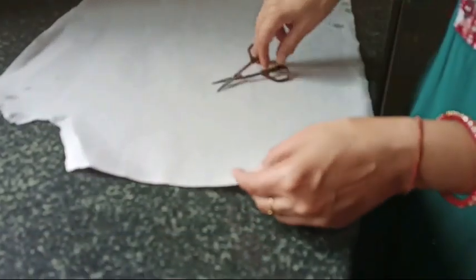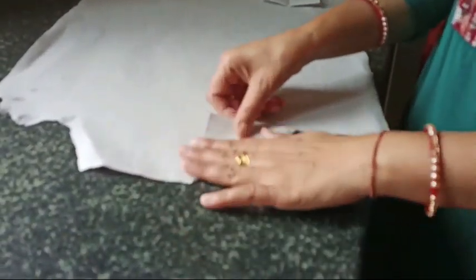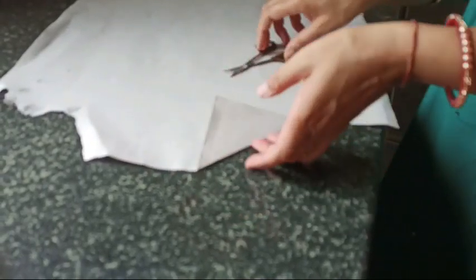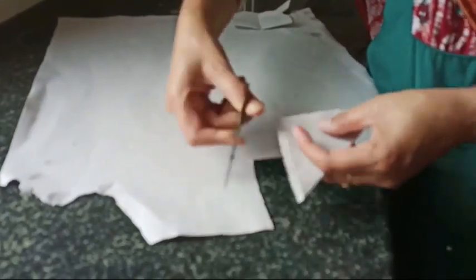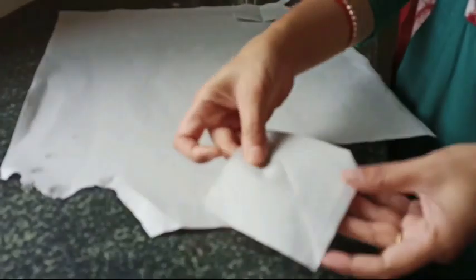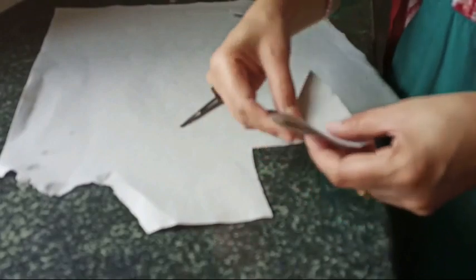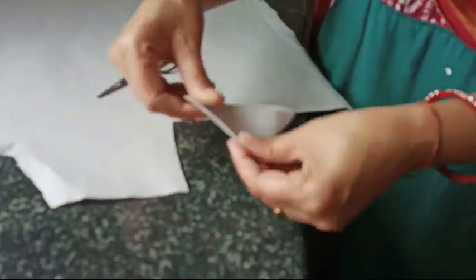Here I will tell you how to filter the precipitates. So how to use actually the filter paper - this is the right way to use the filter paper. You cut down square filter paper. Here I have shown you and then fold it in this manner, then trim the corners.